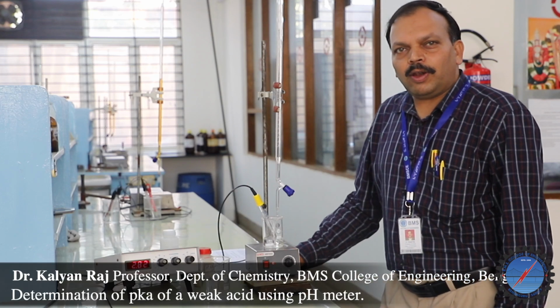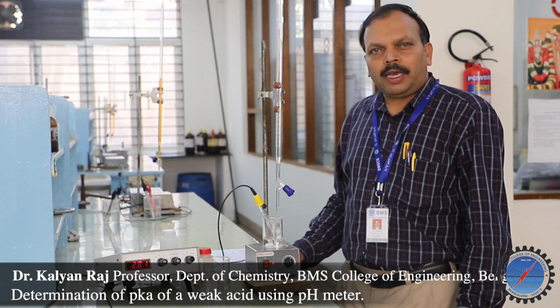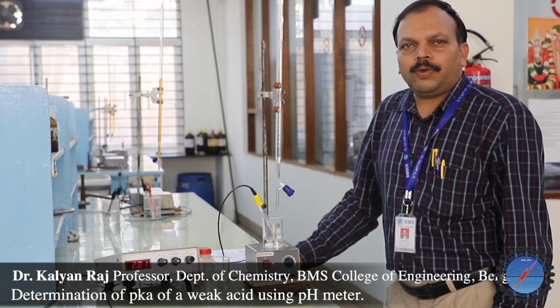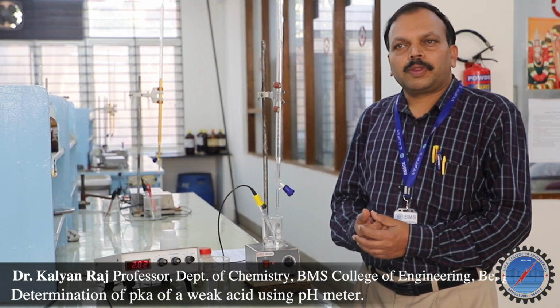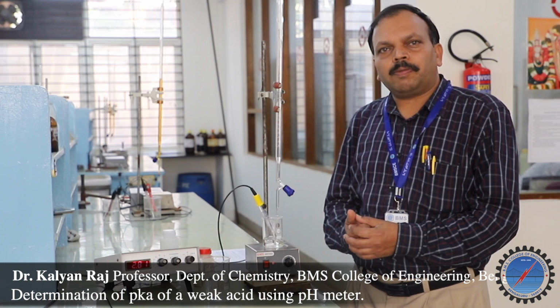Determination of pKa value of weak acid. We are all aware the pKa is the modern method to find out the strength of weak acids. We have different examples of weak acids like acetic acid, formic acid, chloroacetic acid. The concept of pKa comes from the K, that is the equilibrium constant.